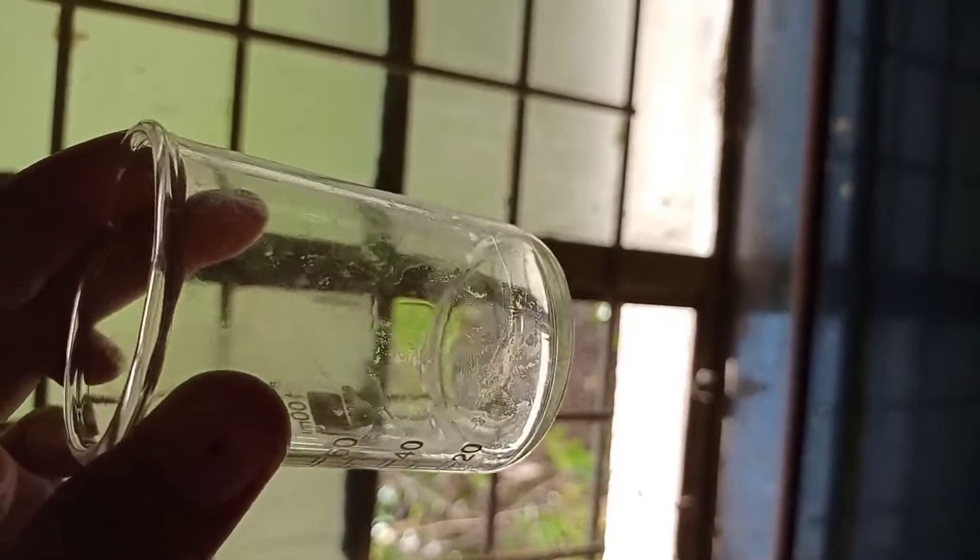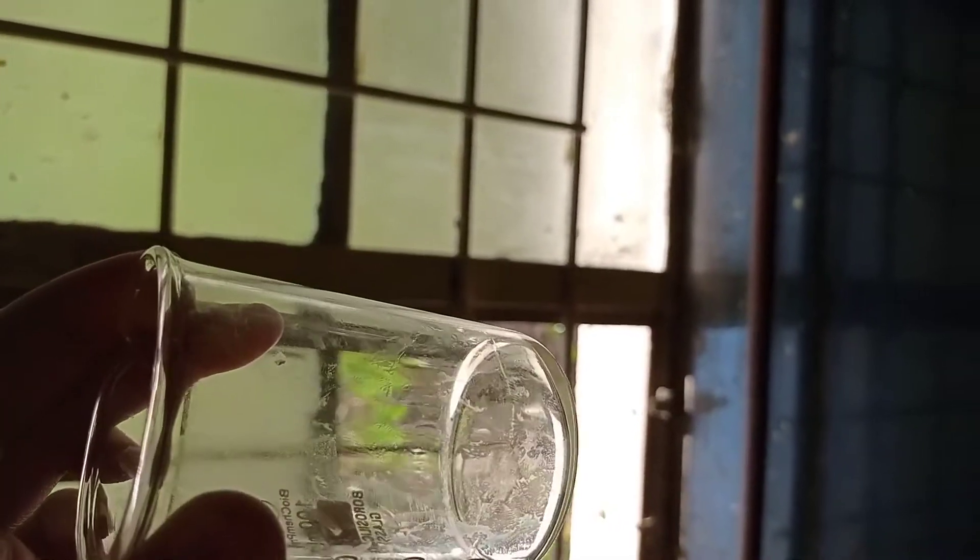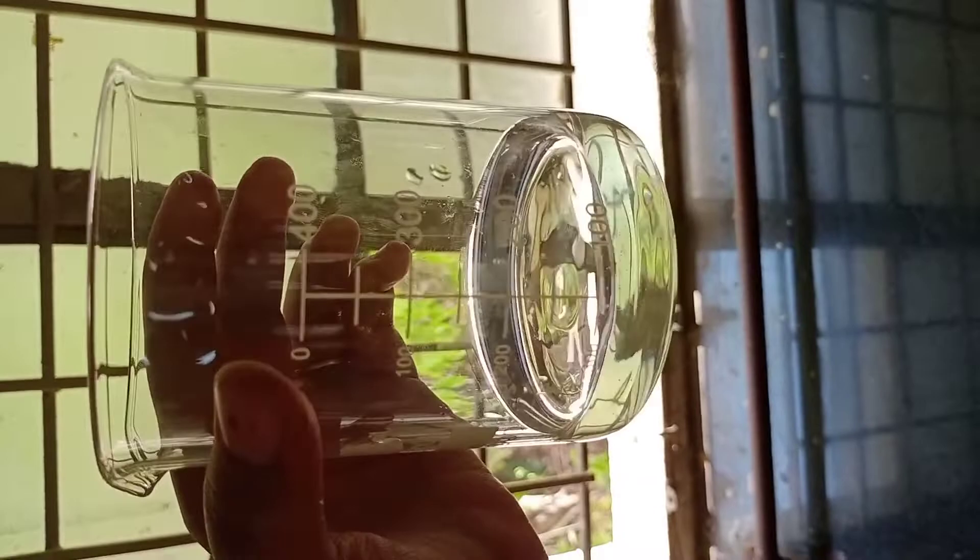Now we are going to add this drop by drop to distilled water. We are taking 100 ml of distilled water.